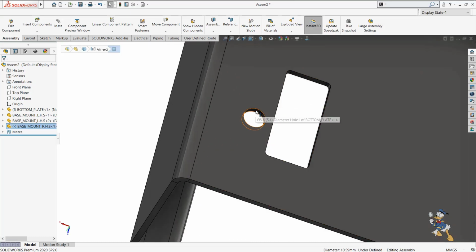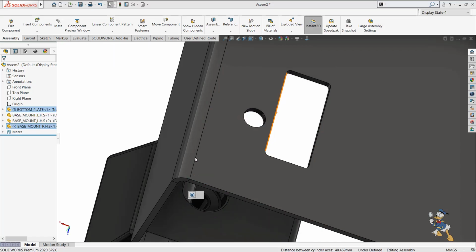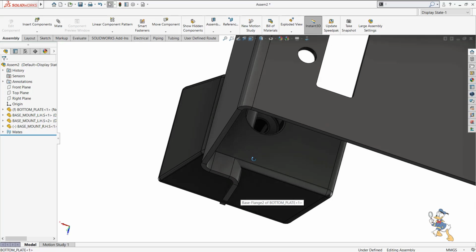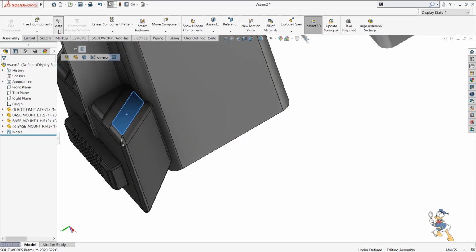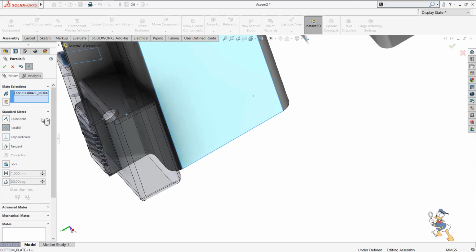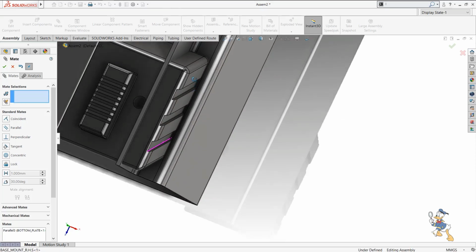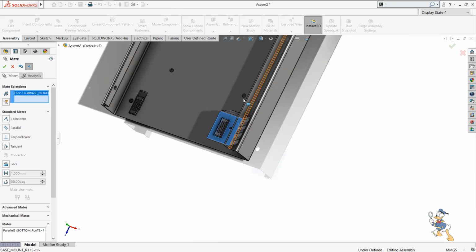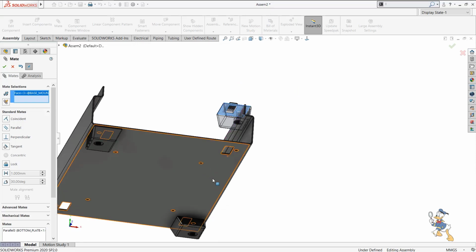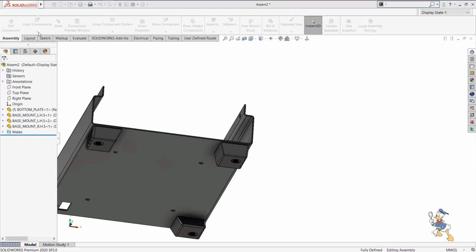So I just need to place it over here by using a concentric mate, and then I just need to make it parallel to this face. So I just need to select this face, select the parallel feature, and provide the face. As it is opposite, I just need to check opposite, and then I make it possible by selecting the coincident face value. So yeah, this is available for us. I can check it out. I can copy this feature with mates as well.